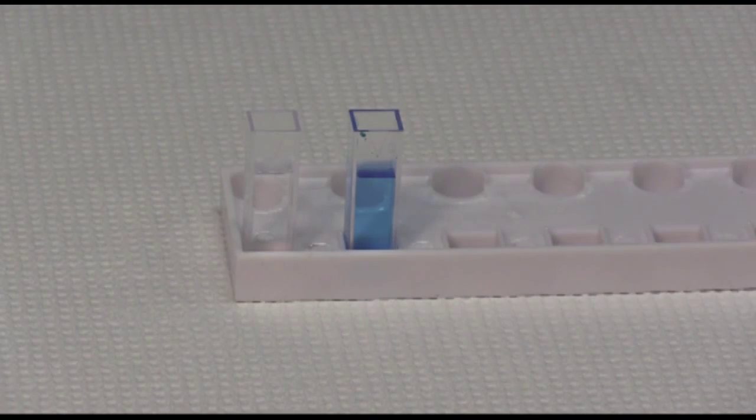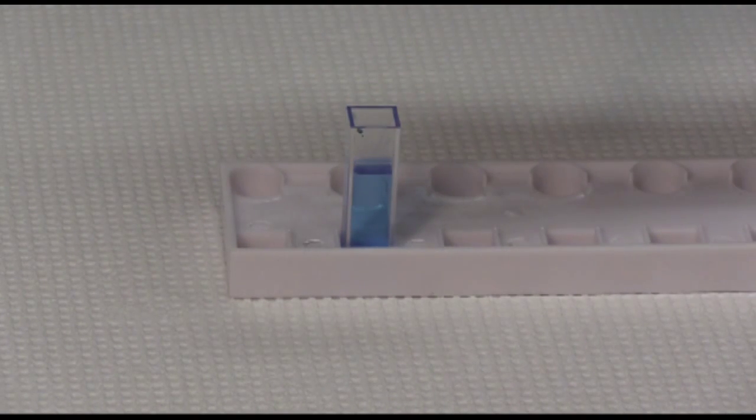In order to prepare your samples, you will always need a blank. Depending on your application or your experiment, the blank will be different. In our case, we will be using distilled water as our blank.